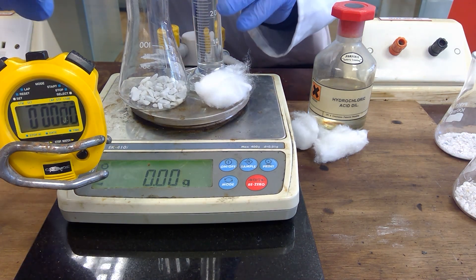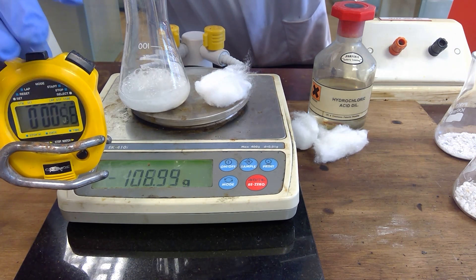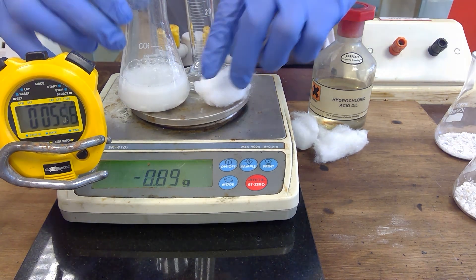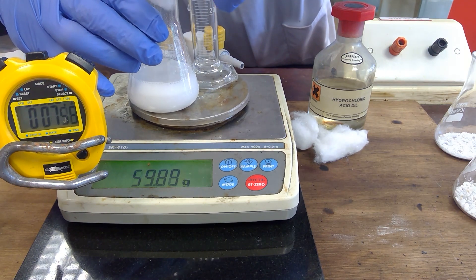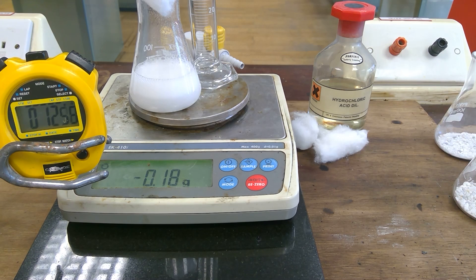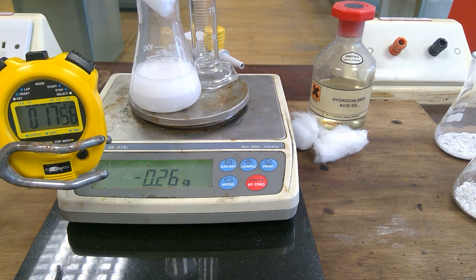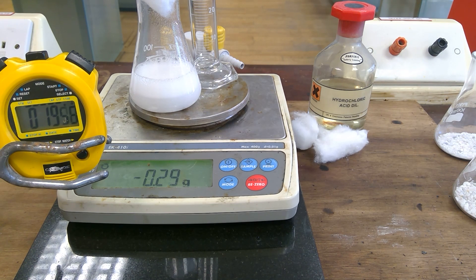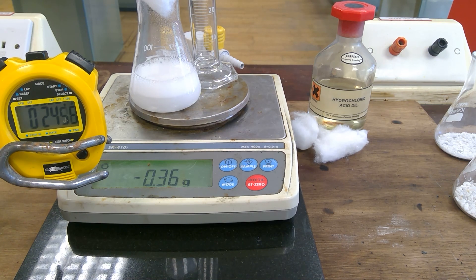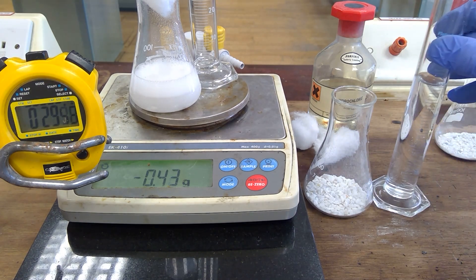Check that it's zero. Halfway through the addition. And of course, place everything back onto the balance, but also put the cotton wool into the flask.